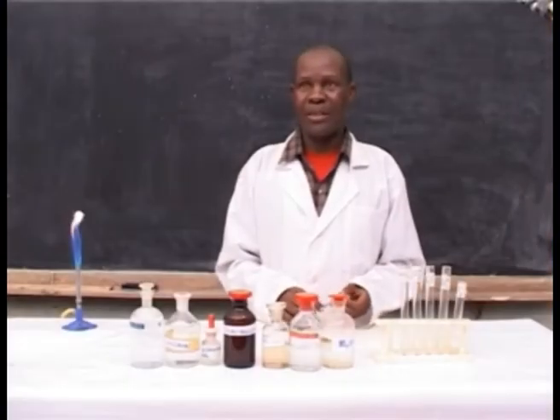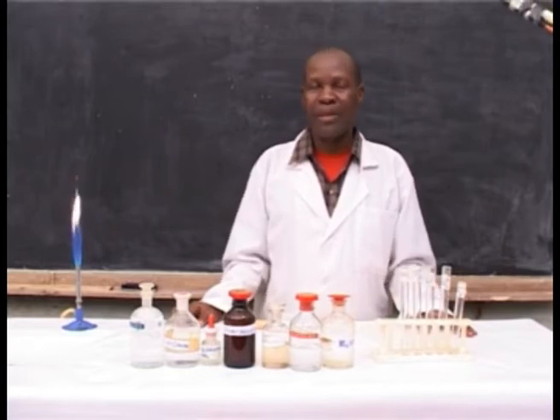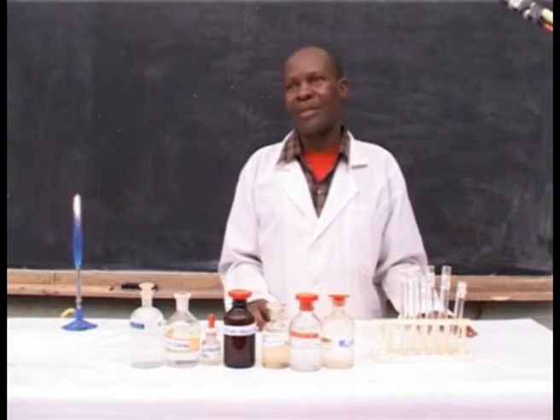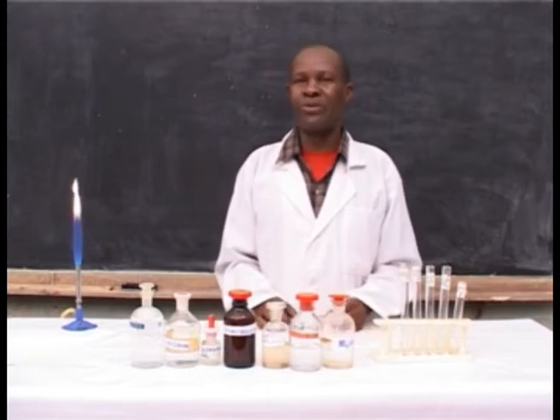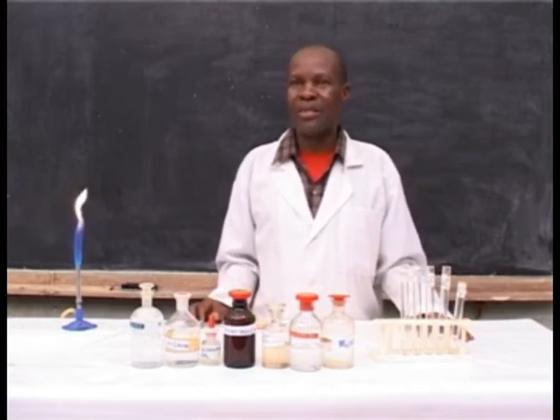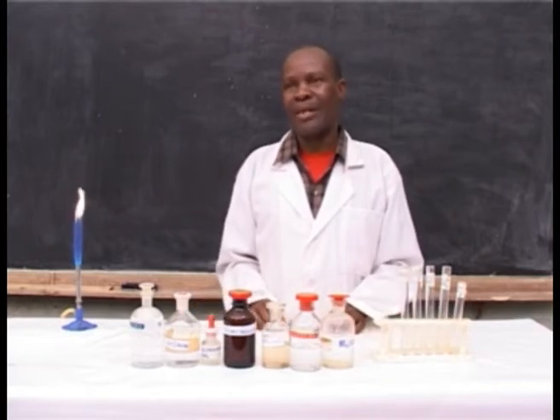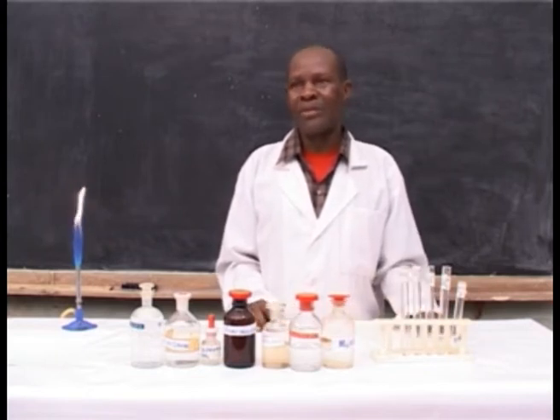The topic is confirmatory tests for the cations and anions. Introduction: detection of cations and anions depends upon the availability of the salt in the form of solution. The preparation of the solutions of the salt during a preliminary test is of great importance in the test of the cations and anions. After detection of the cations and anions, one has to confirm their presence by using other means.